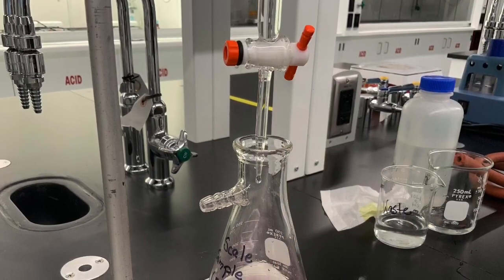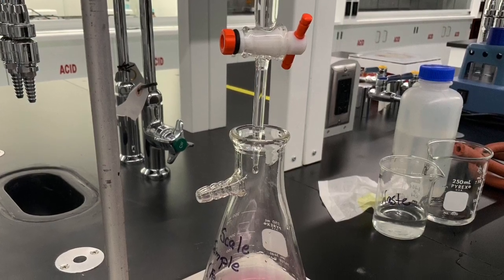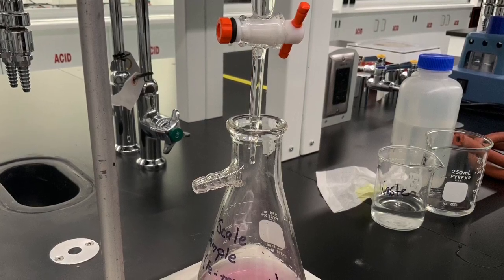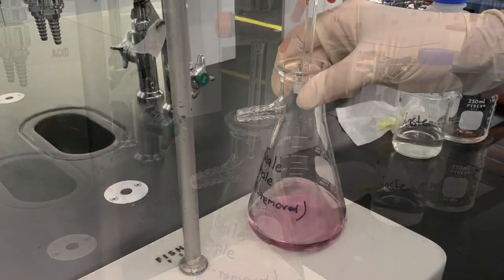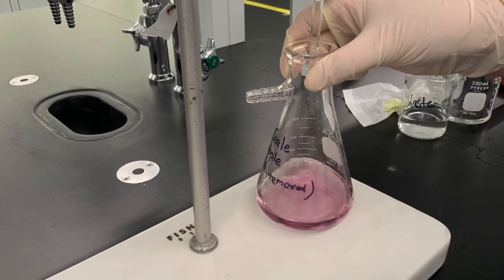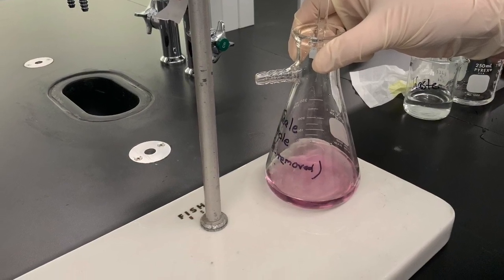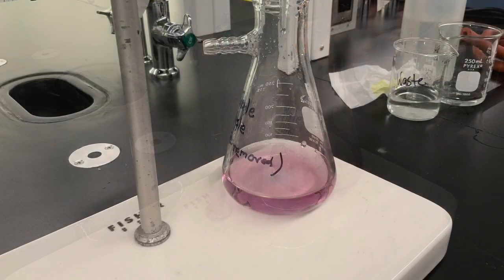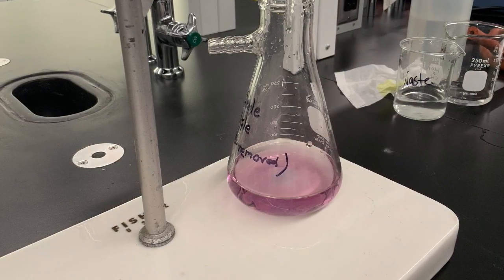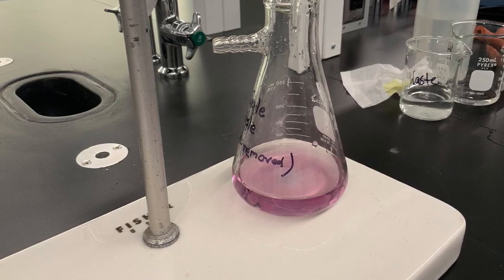For the titration, we now release the EDTA solution into our calcium solution, and we do that in 2 runs. The first one is relatively fast, and we just want to determine the approximate amount of EDTA solution we need. And in the second run, we repeat the whole process but become really slow with a really slow drop rate to determine the exact amount we need to react all the calcium with the EDTA that we add.